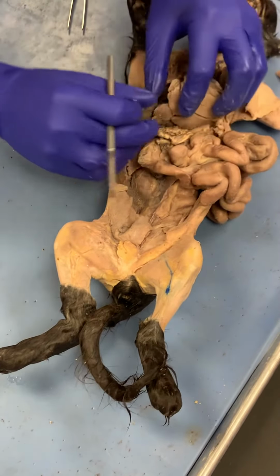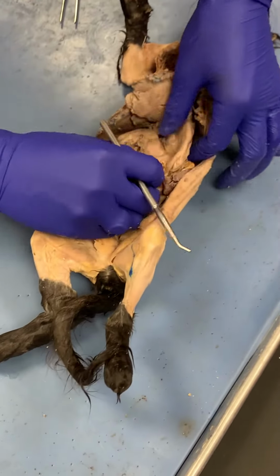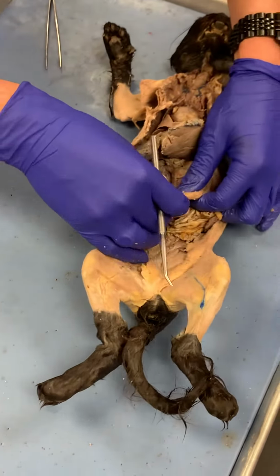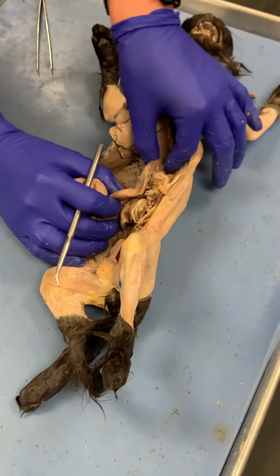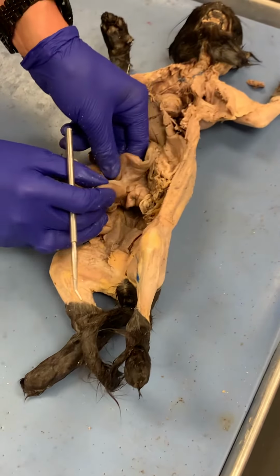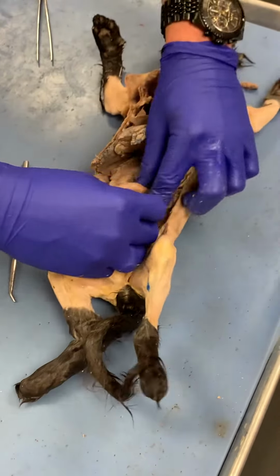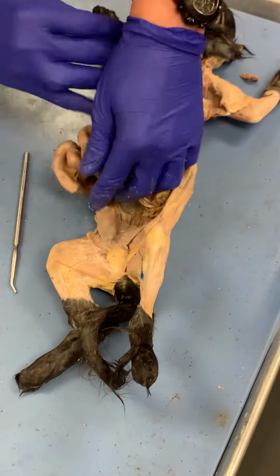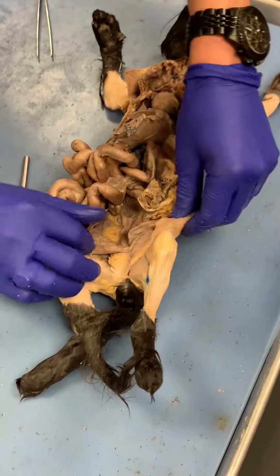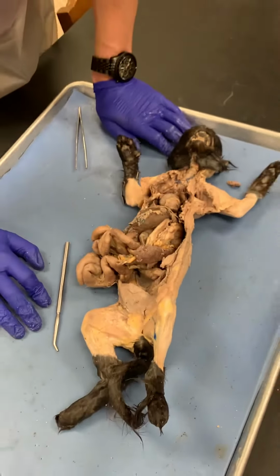And so what I do is find the stomach, and the duodenum is the shortest part of the small intestine. I would say probably about right there. That would be the duodenum, and then it's the jejunum for a while until, if you look at it, even if we follow it, it's really long. So I'm not gonna follow it entirely, but yeah, those are all the structures here on this cat.